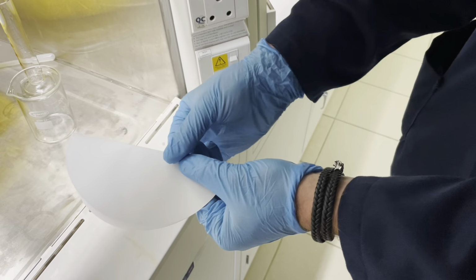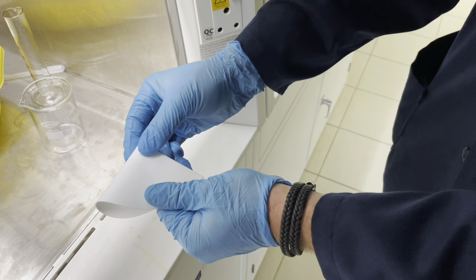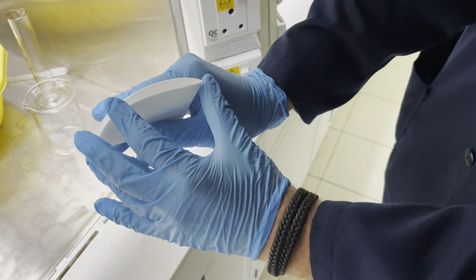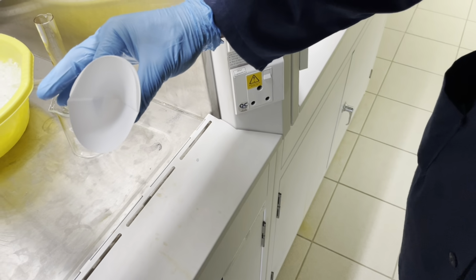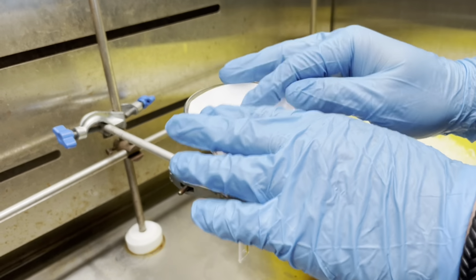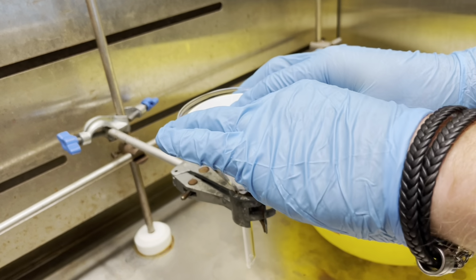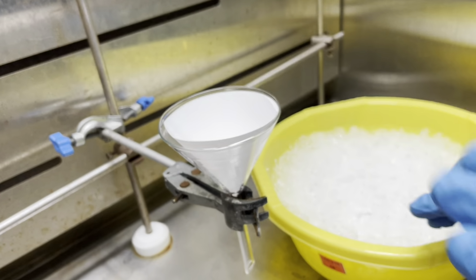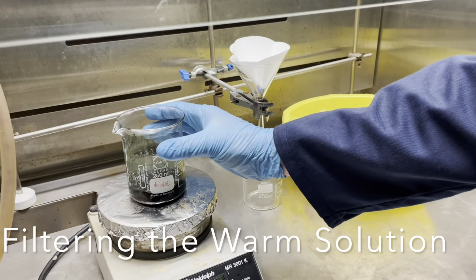For the next filtration, we will use gravity filtration. You need to ask yourself why. Fold your filter paper as illustrated here in the video and place it in a funnel which has been safely secured at the back of your fume hood. Your funnel, safely secured in a clamp at the back of the fume hood, will be used as the top part of your filtration system, along with a beaker at the bottom.